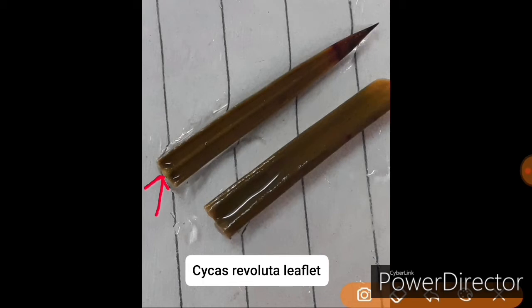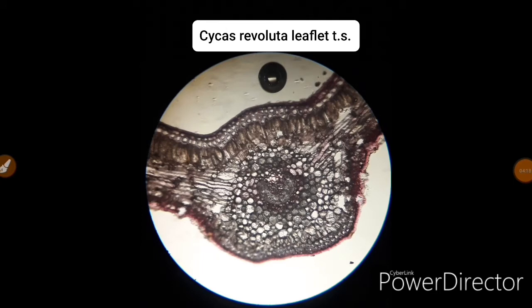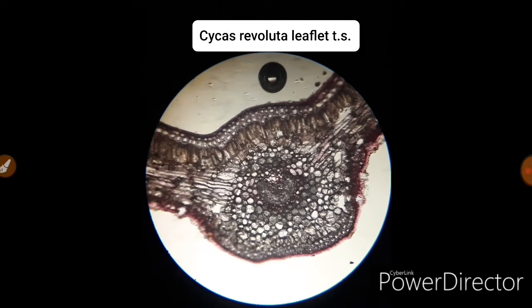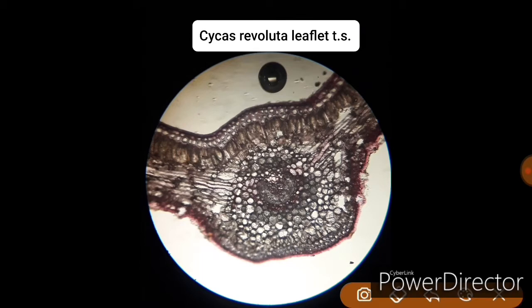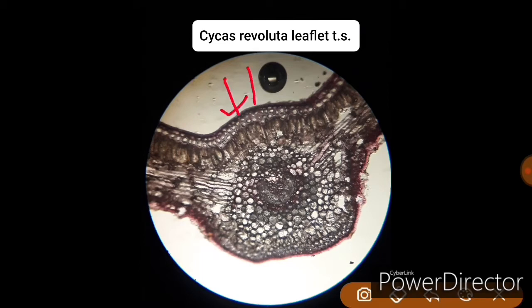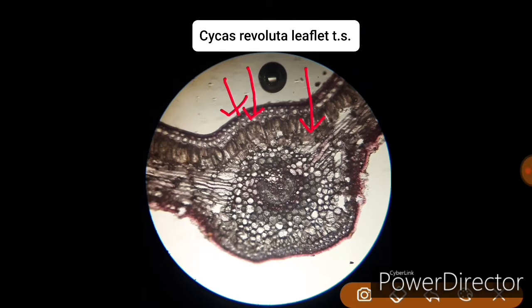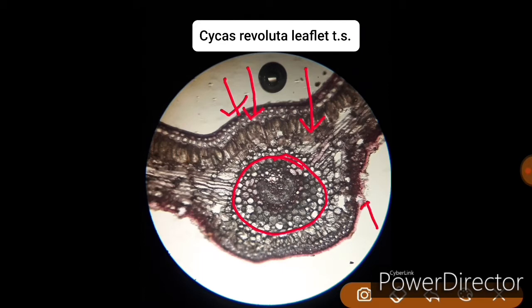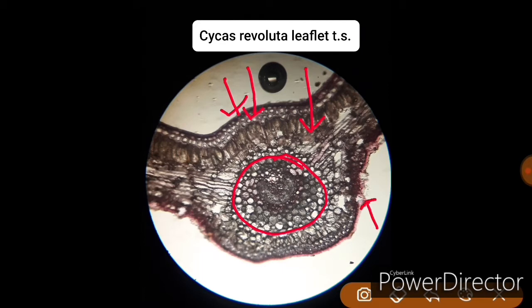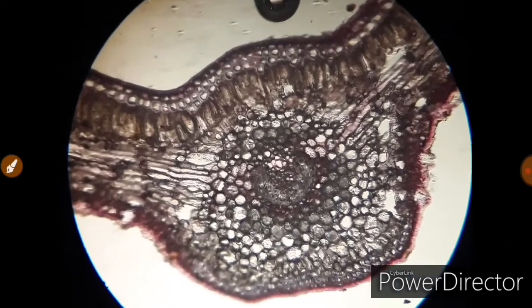This is a transverse section of a Cycas revoluta leaflet — it is unstained. In this section you will be able to clearly see the epidermis, the hypodermis which is slightly sclerenchymatous, the palisade cells, the central bundle sheath, and the vascular bundles. The sunken stomata are also clearly visible in this slide, along with the accessory transfusion tissues.